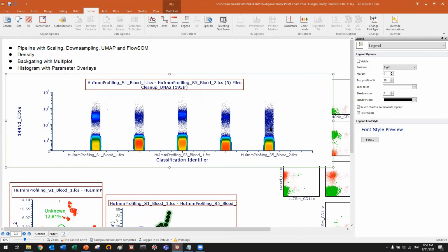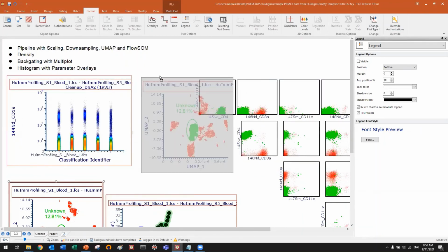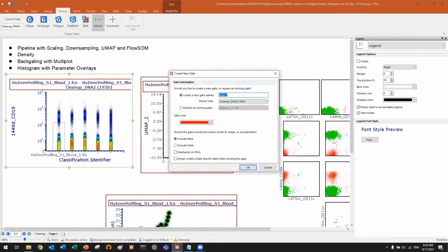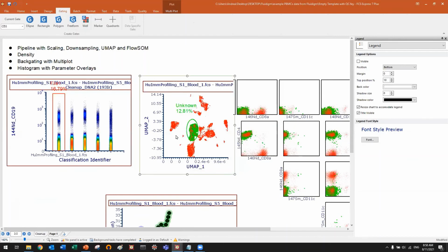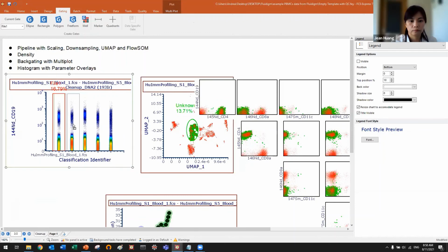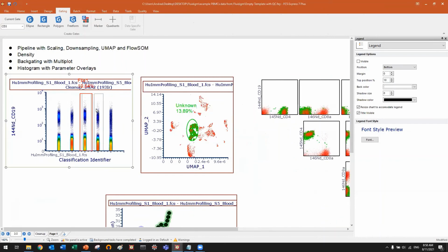So if you have multiple samples, just merge them. Feel free to send me an email if you have any doubts, and then run UMAP, tSNE, FlowSOM, whatever, on the merged data. So you will have a unique tree, a unique map, for multiple samples. Then you will always be able to say, I want to create a gate on file number 1, and then apply this gate on my UMAP. And you see, I can change my gate and see which events on the UMAP belong to that file, as you can see here. Did I answer your question, Colin?